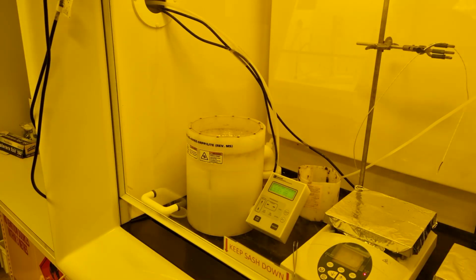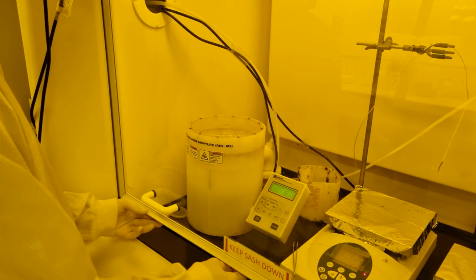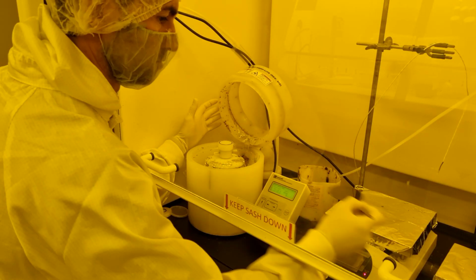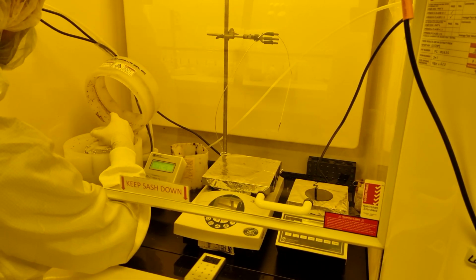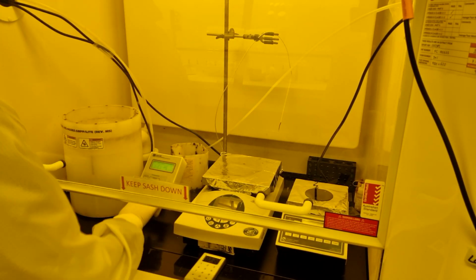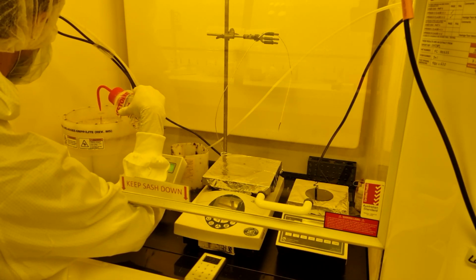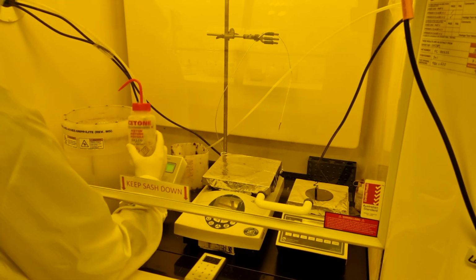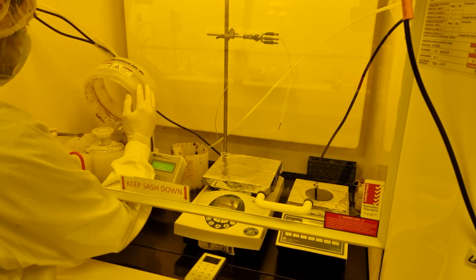As before, we add the photoresist to the center of the wafer, covering about 1/4 of the radius. The soft bake starts at 65 degrees for a few minutes, depending on resist thickness, then a longer time at 95 degrees. You can start cleaning the spinner bowl while the wafer is baking, but be careful not to allow acetone spray from the bottle to land on the wafer.